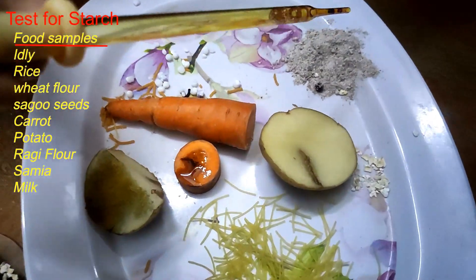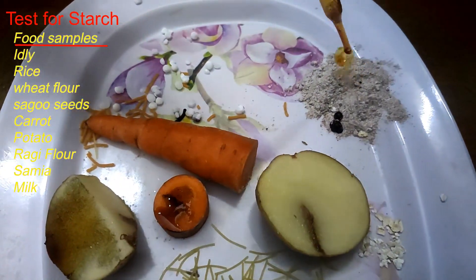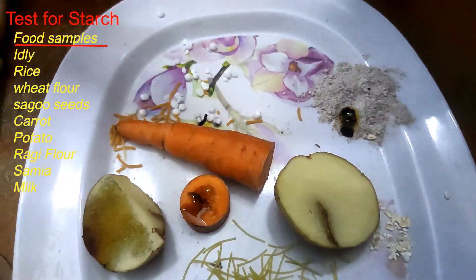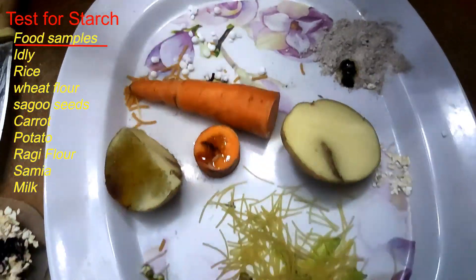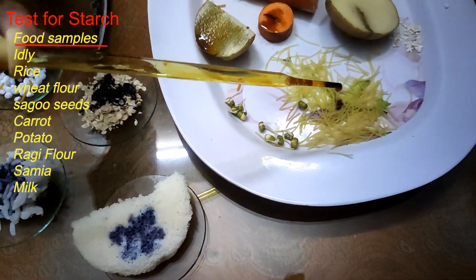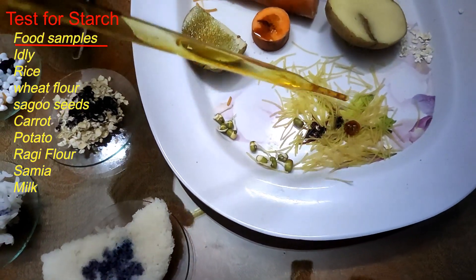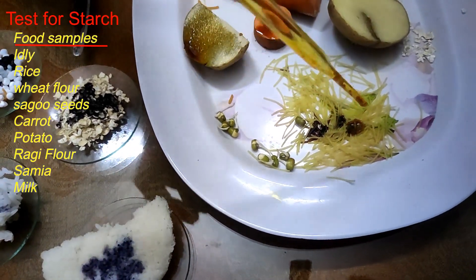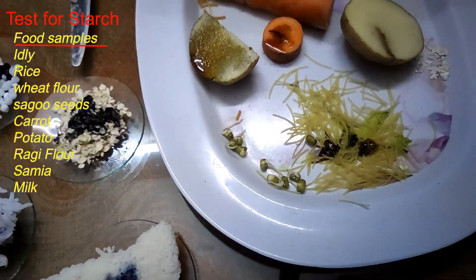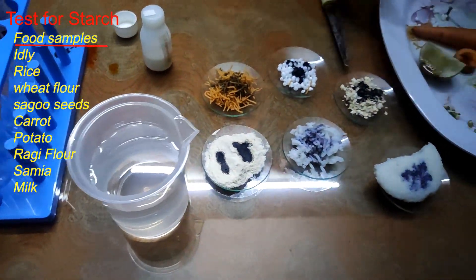Next we will check the ragi flour. I added a few drops of iodine and it also changes to black color. Then we move to semia — bambino vermicelli. Adding iodine on that, it too changes to black color.